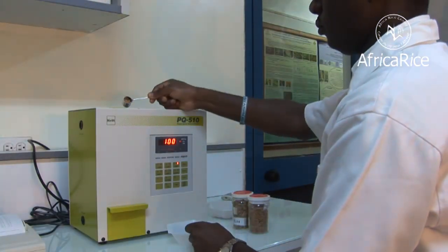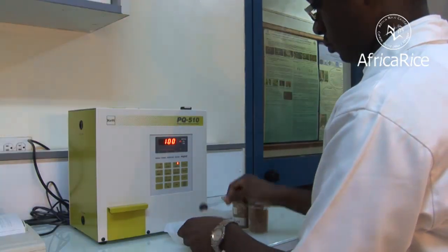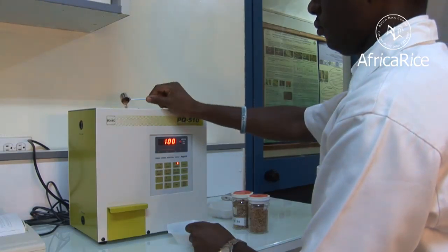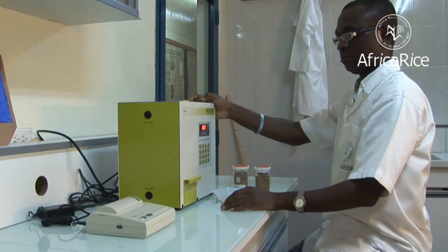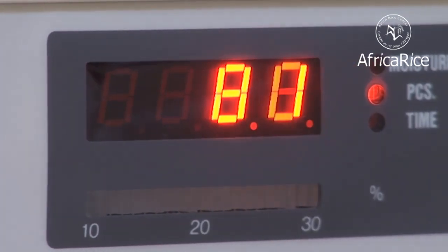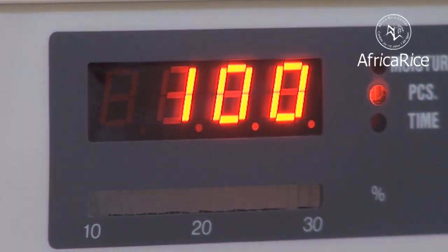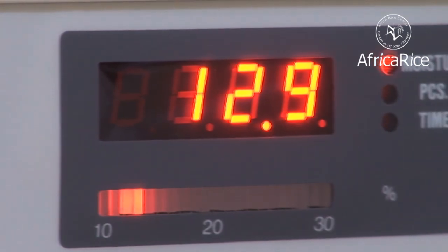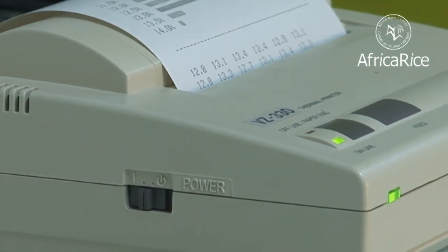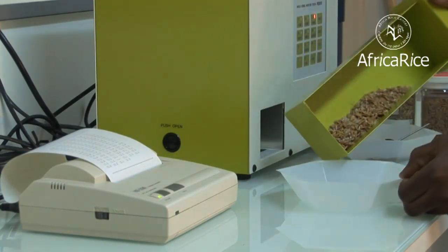It is important to know the level of moisture in rice grains to be analyzed. At the Africa Rice Grain Quality Lab, there is an equipment known as the Single Grain Moisture Meter, which is programmed to determine the moisture content of 100 individual grains and give the average value. This shows whether the grains are of uniform moisture distribution or not.